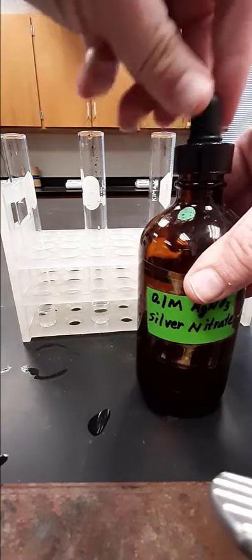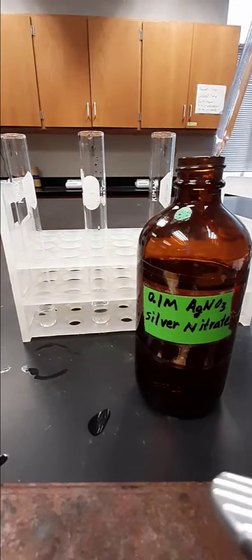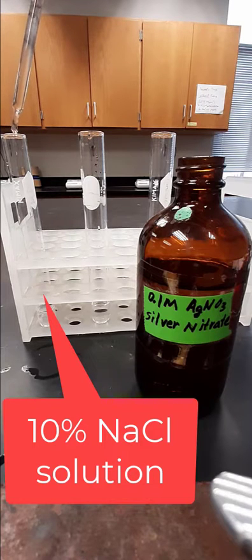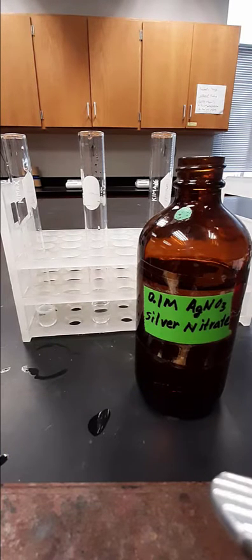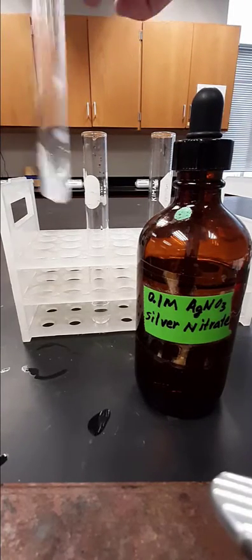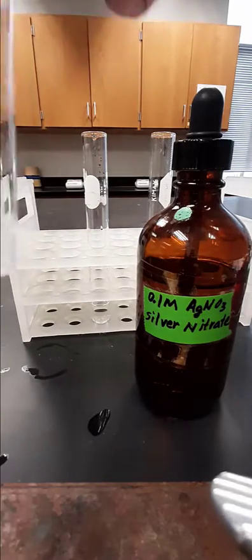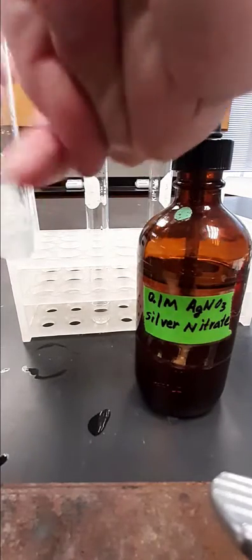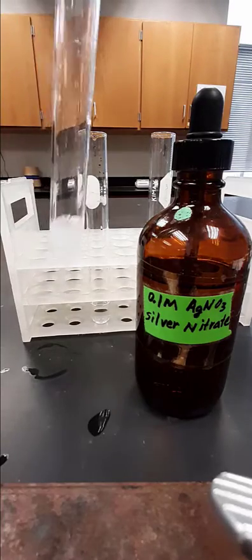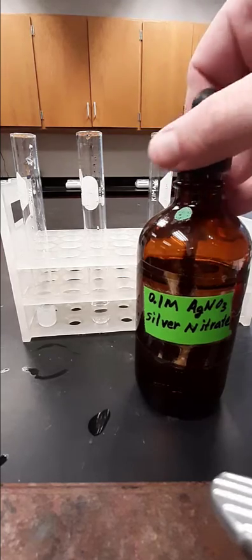The first species that we're going to investigate is the chloride ion. I'm going to add my silver nitrate solution to the test tube on the left, which already contains a solution of sodium chloride, and therefore already has chloride ion in it. You will notice upon shaking that the solution becomes cloudy. This cloudiness is the result of the formation of tiny crystals of silver chloride, and is what we will look for in a positive test for chloride ion.